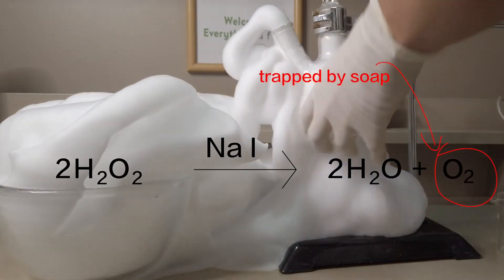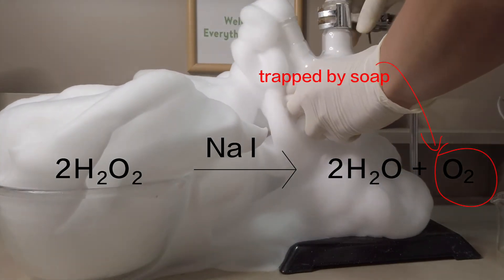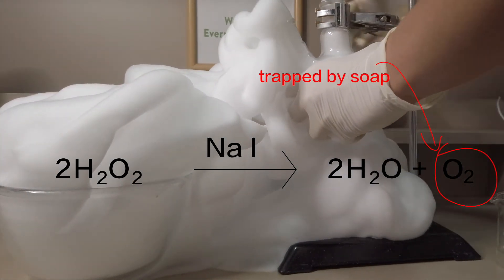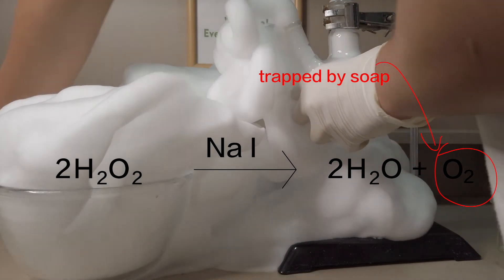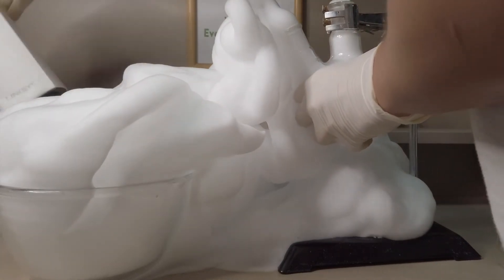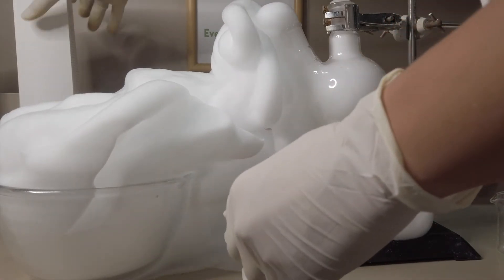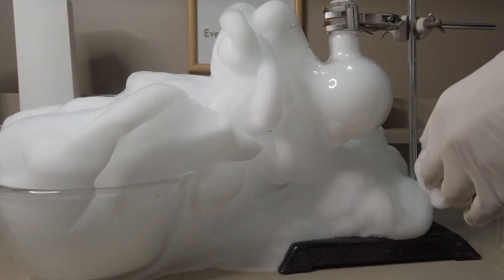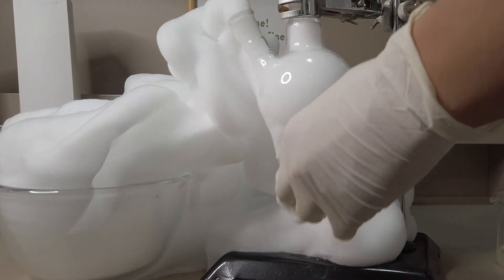This is a decomposition reaction of hydrogen peroxide catalyzed by sodium iodide. A large amount of oxygen gas is released which is then trapped by the soap creating a lot of foam. Also the reaction is exothermic so please be aware of the heat despite its innocuous appearance.